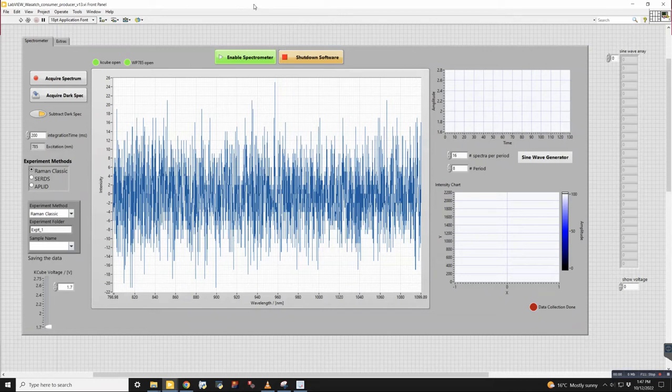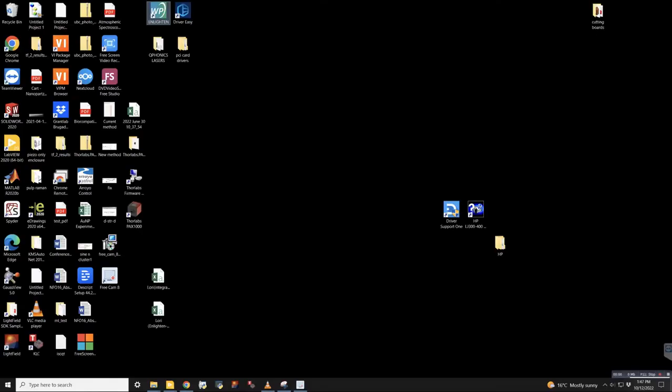So off camera, the first things that we did was turn on two pieces of hardware that this connects to, specifically the K-Cube and the Wasatch probe. So the first thing to know for sure is that we do not have either of these softwares open. Enlighten is the one that opens the spectrometer. That needs to be closed and shut down.